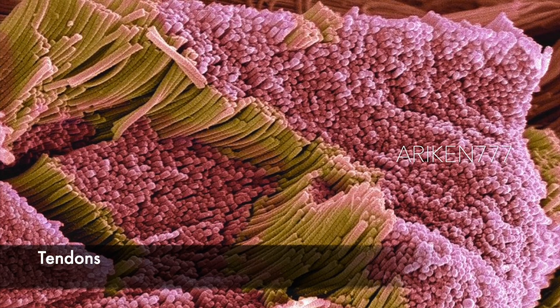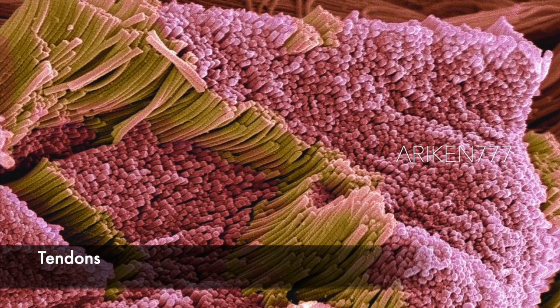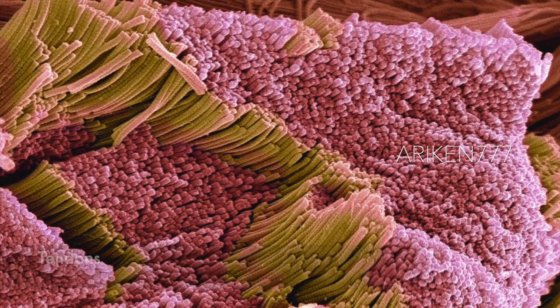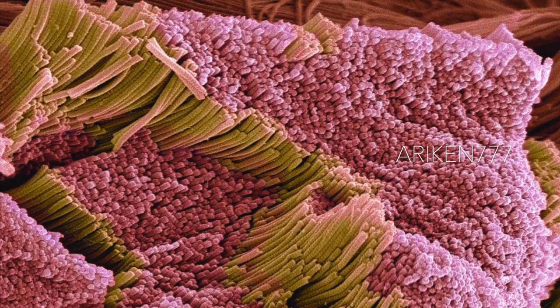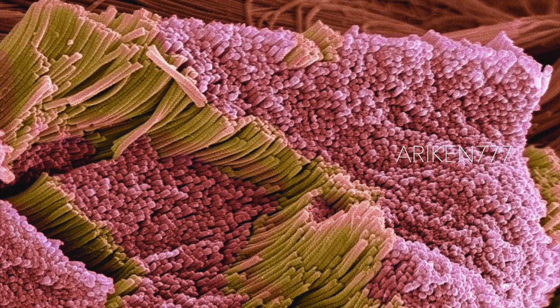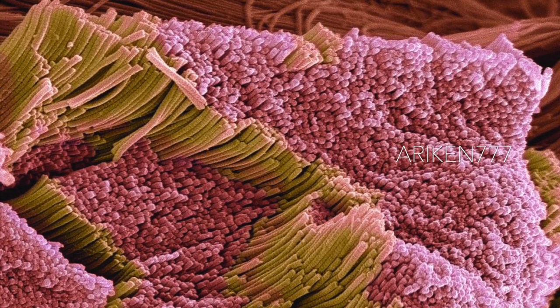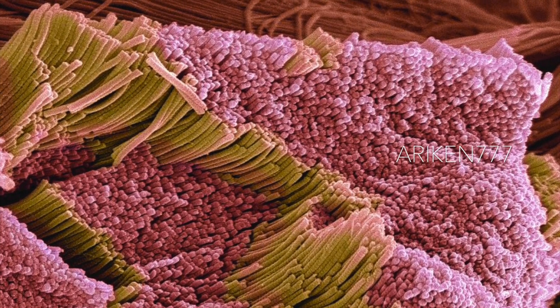This is a tendon showing bundles of collagen fibers. The parallel alignment of the fibers makes tendons inelastic but flexible. Tendons attach muscle to bone.